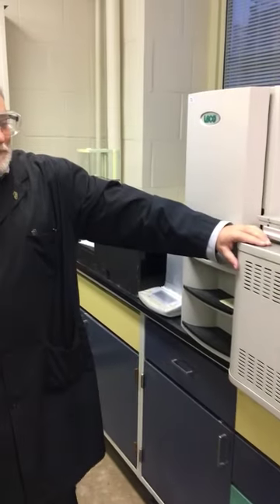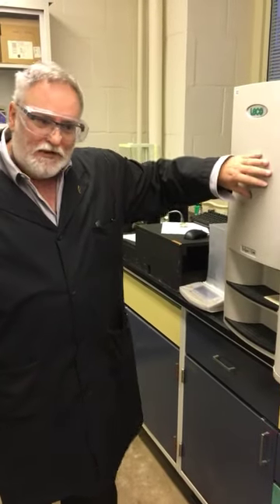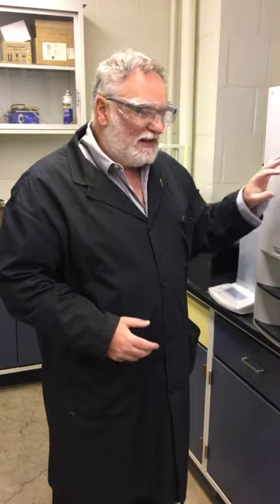We do need, before we start, to do a whole bunch of conditioning runs. We do a system check, which says the infrared sensors are up to temperature, as well as the thermal conductivity apparatus is working. It flushes the system with helium to get rid of background air contamination. But it's not enough when we start up to immediately start running. So what we have to do is a whole bunch of conditioning runs.